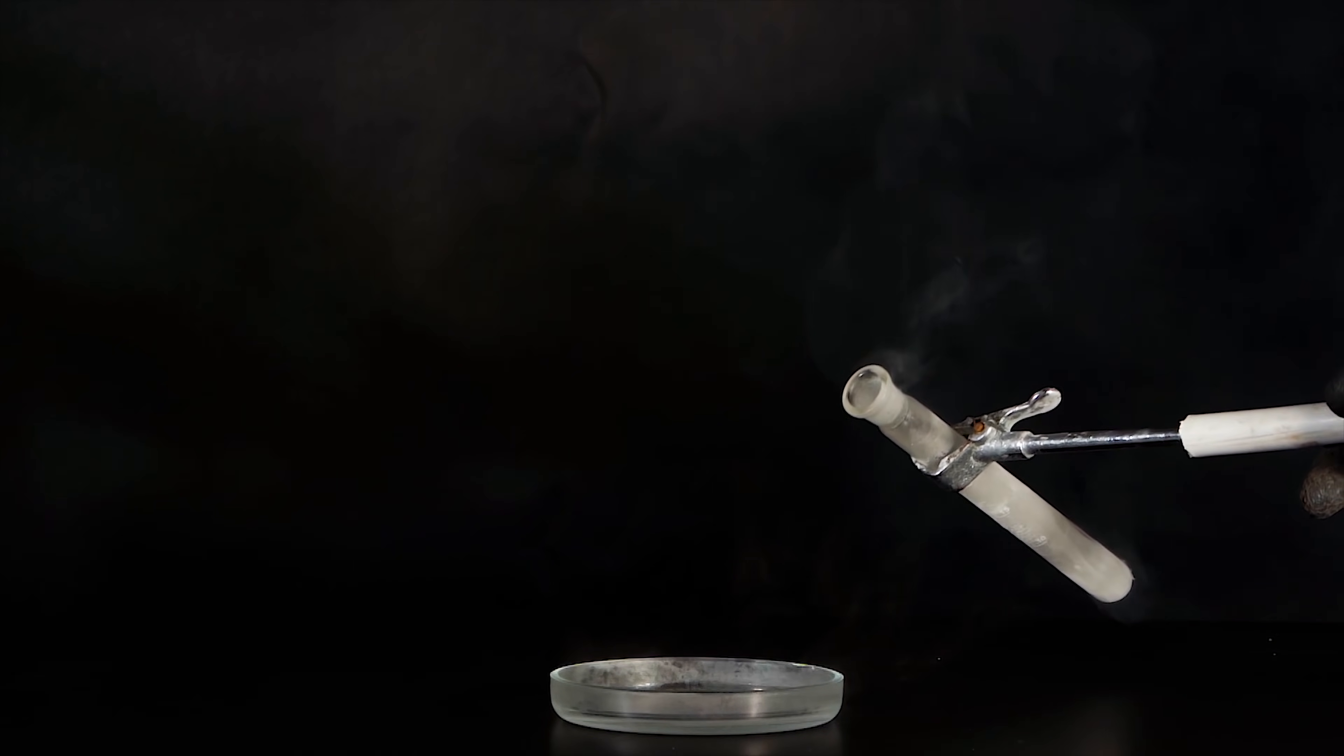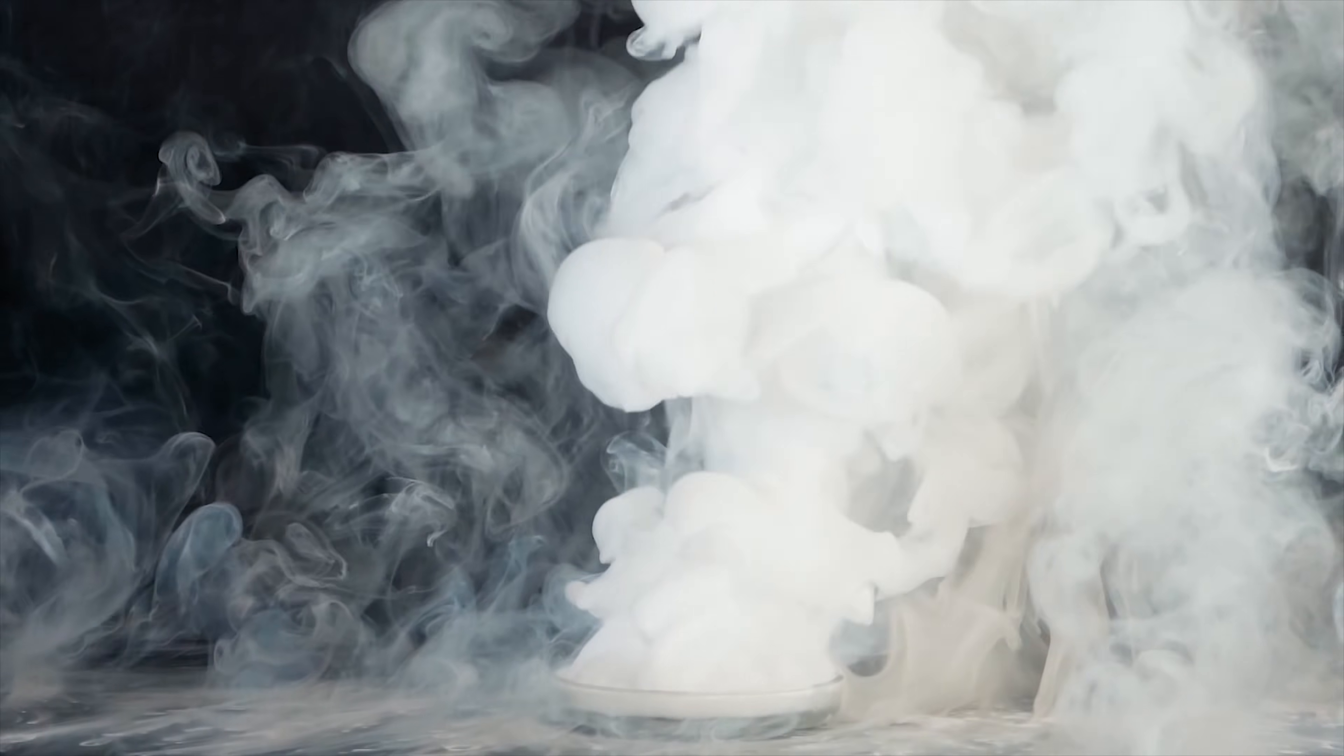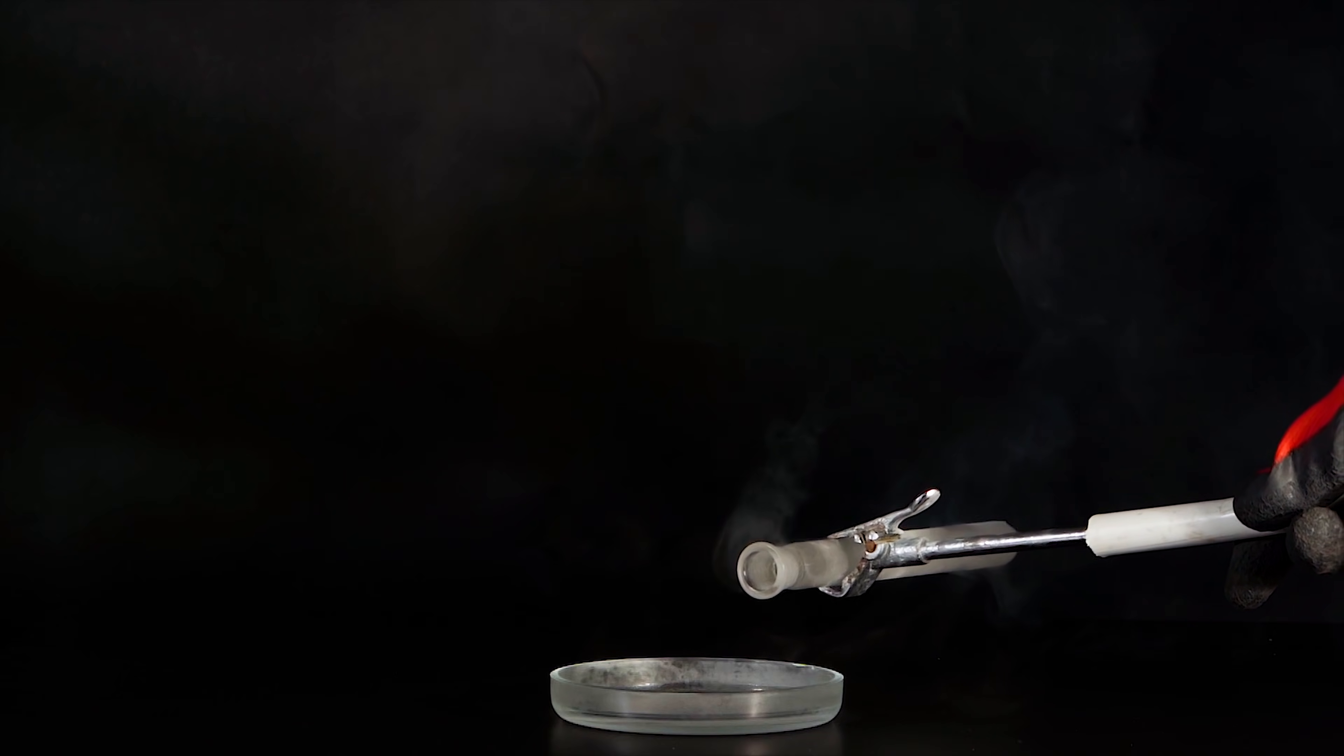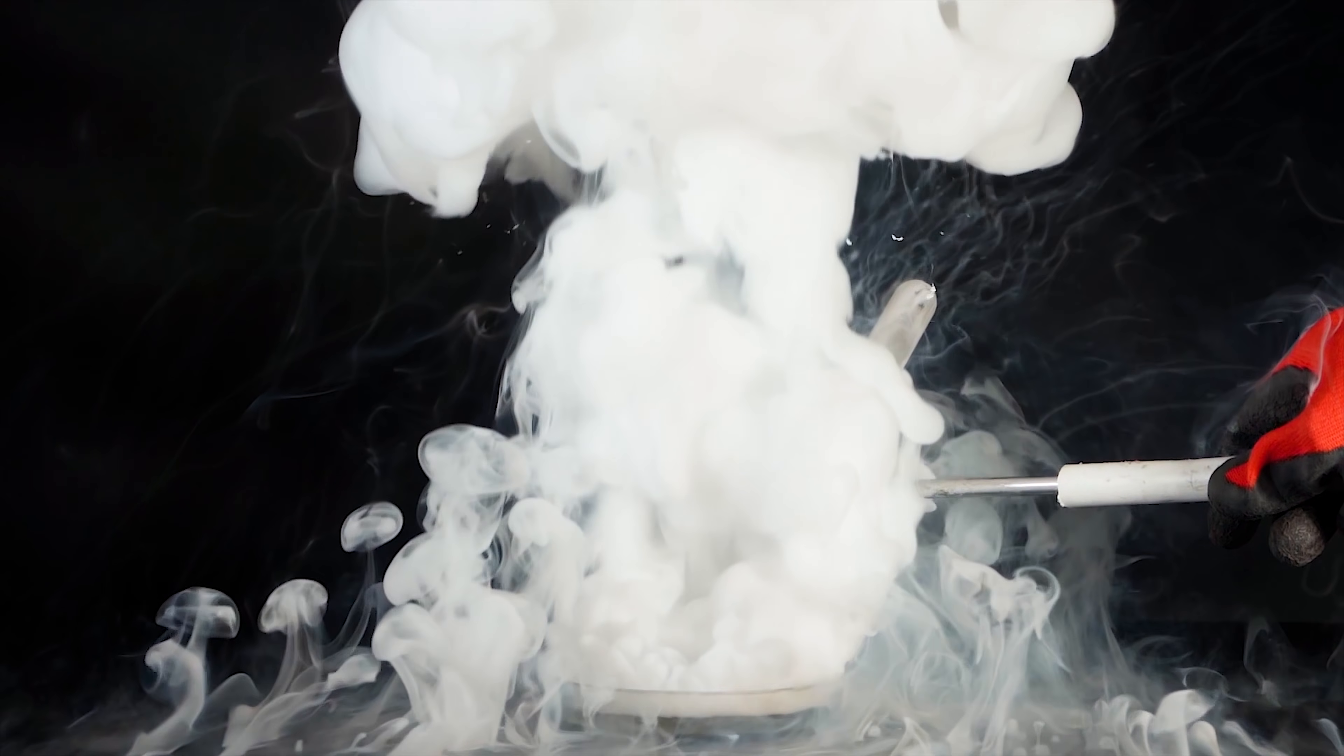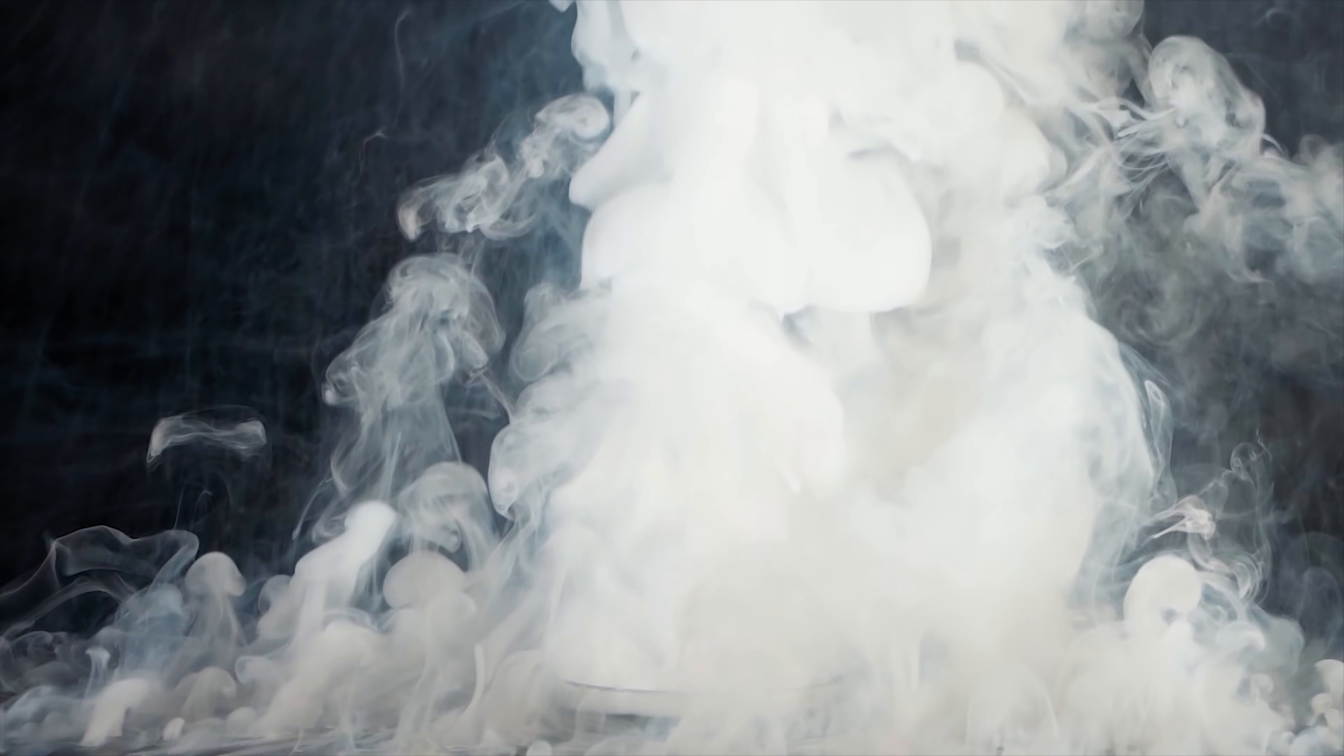In the middle of the petri dish. All right, all right. And now let's check out what it might be.